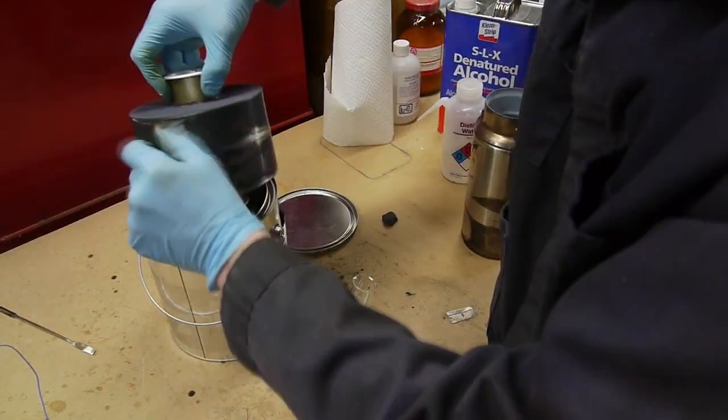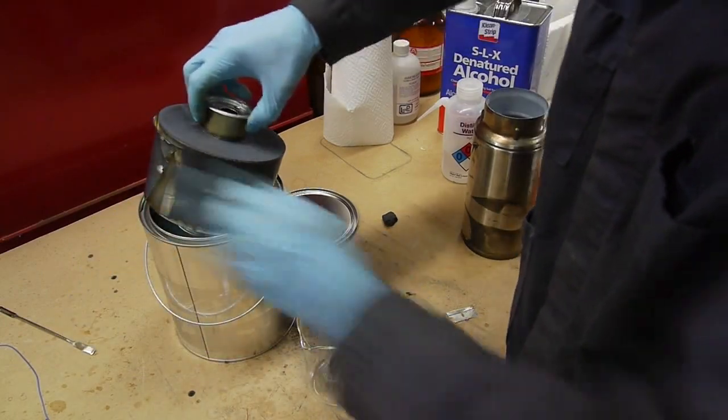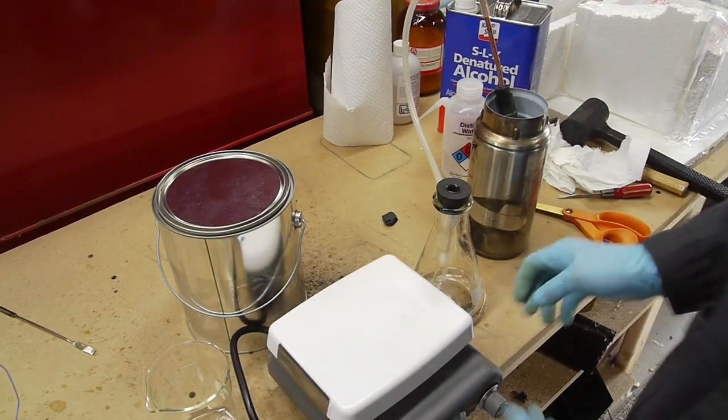So for my second attempt, what I did is I put some lithium metal in the test tube and then rigged it up to the ammonia gas generator, and put the whole test tube with the metal already in it in the cold bath.